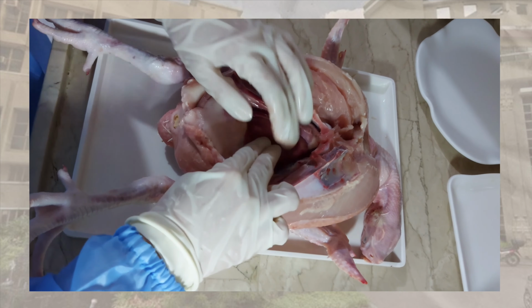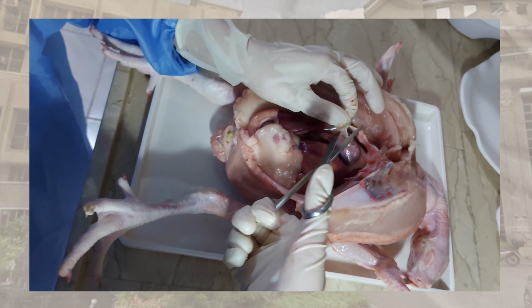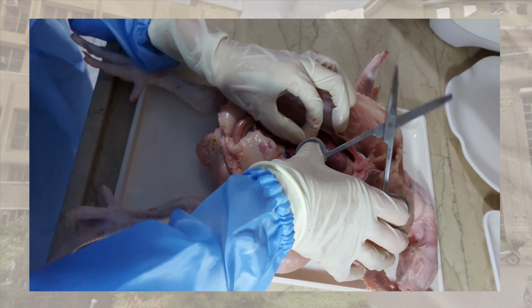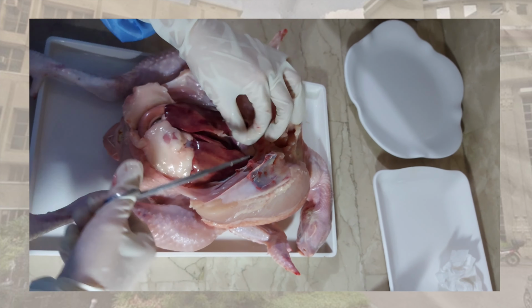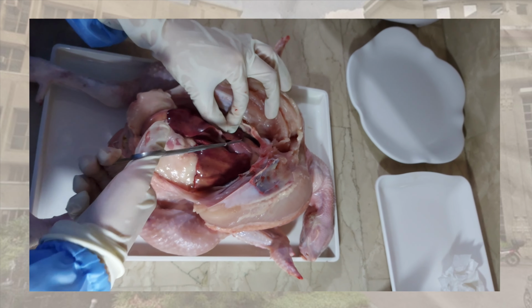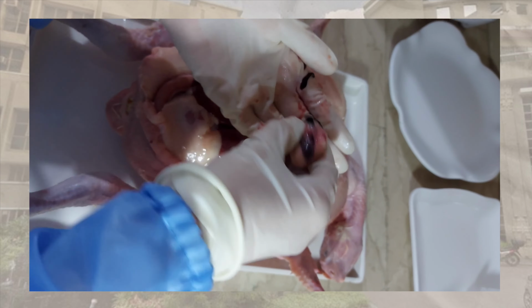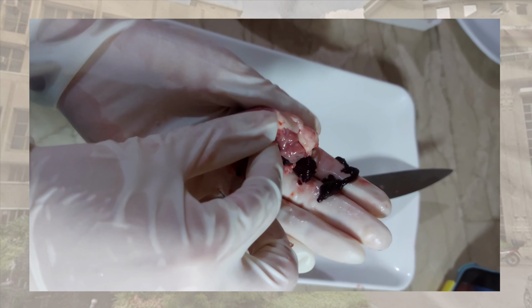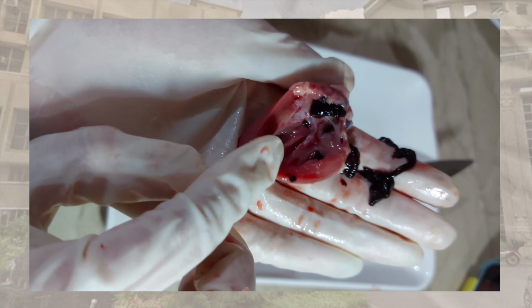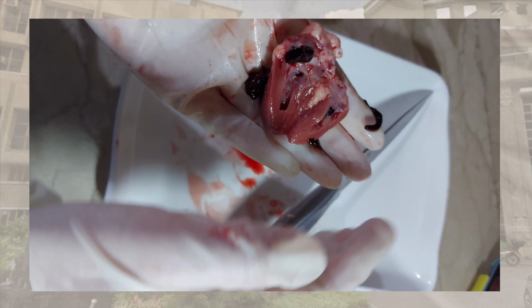Meanwhile, lateral to the intestines is the stomach. The heart, which is slightly superior to the liver, is first examined. To fully reveal the heart, the pericardium, or the fibrous sac, is removed. The pathologist cut the heart using the frontal plane and saw that there is a massive blood clot in the heart. This is the cause of the symptoms that the patient showed.